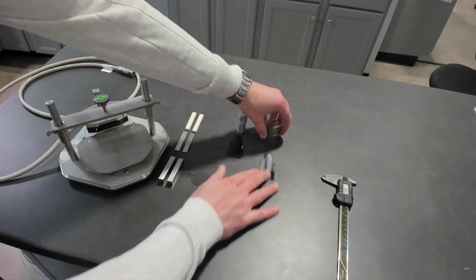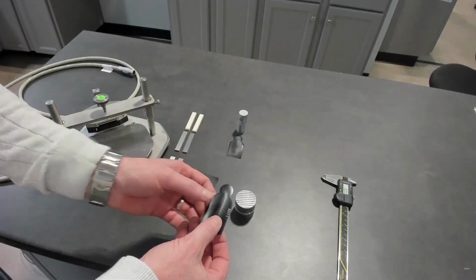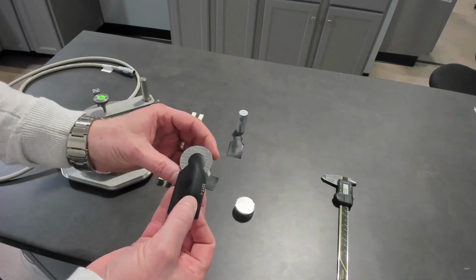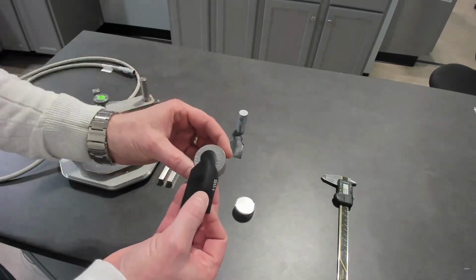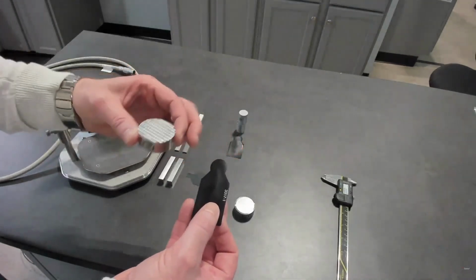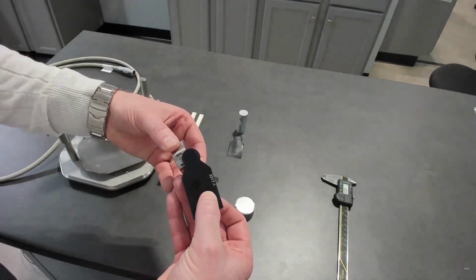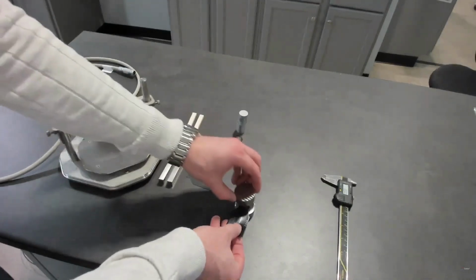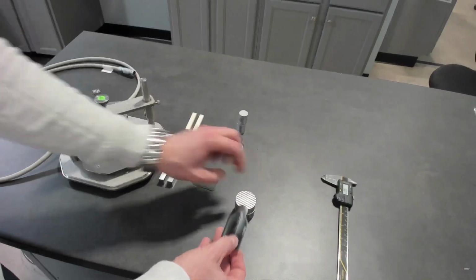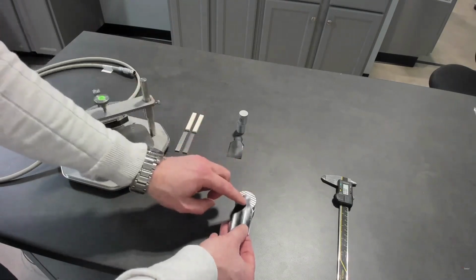When you look at transient plane source, according to ISO 22007-2, one of the principal orientations is that your sample doesn't have to be round, but in each direction is approximately twice the diameter of the sensor, and the thickness is at least equal to or greater than the radius of the sensor you're using. That's to allow, whether it's symmetric or asymmetric, single-sided, three-dimensional penetration. That's the typical bulk three-dimensional approach for a transient plane source sensor.